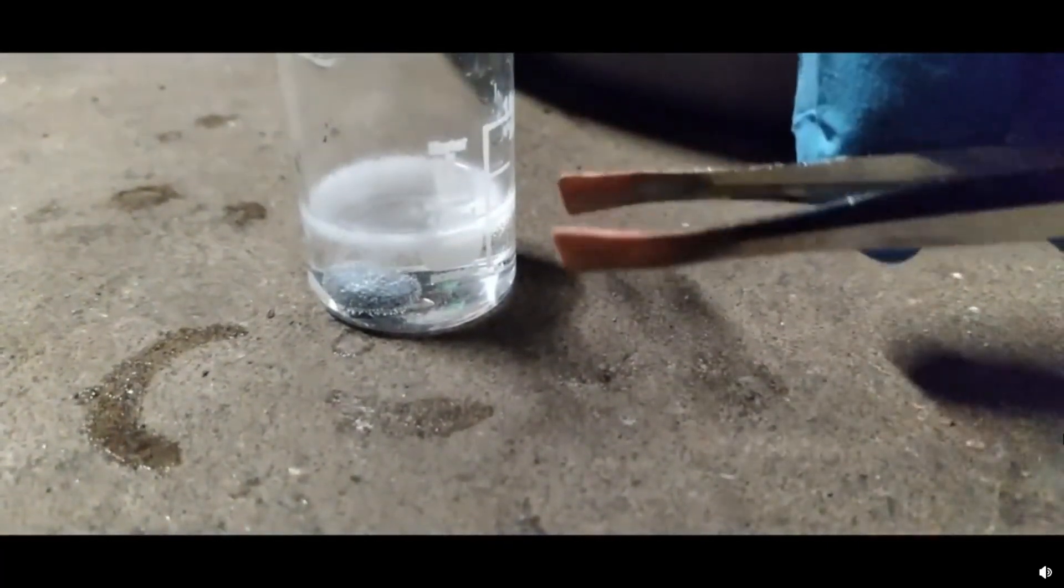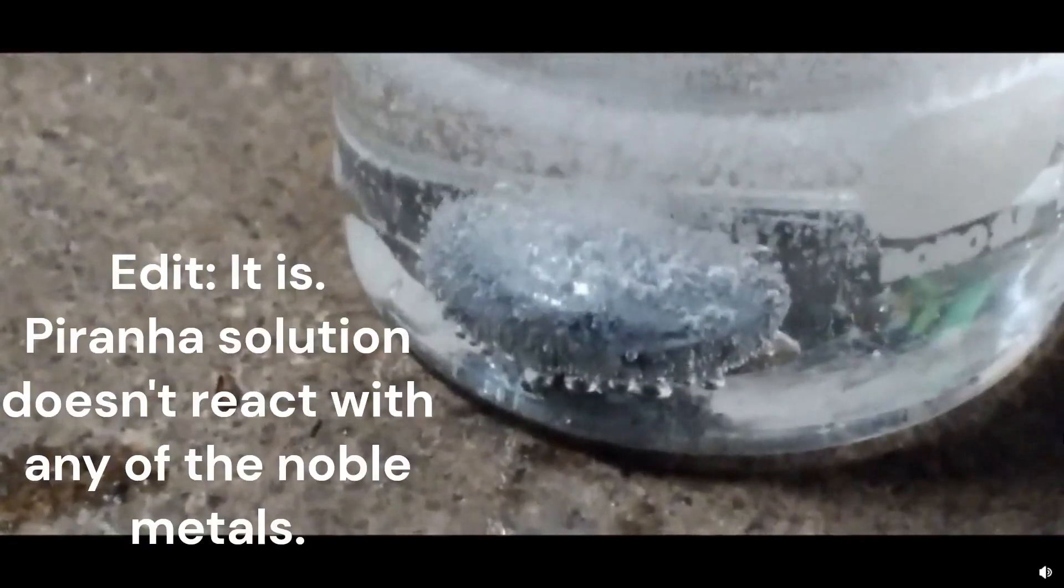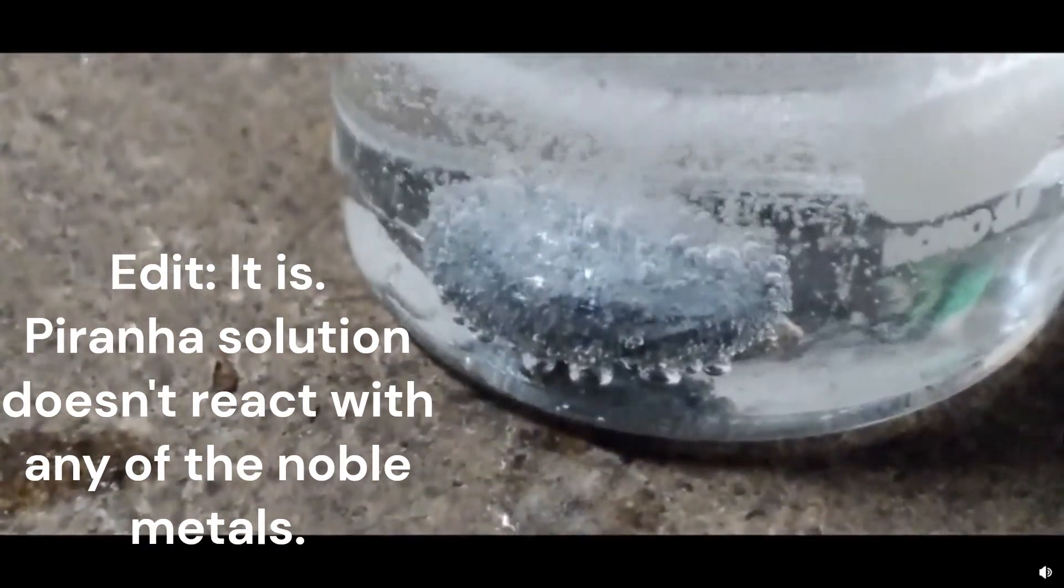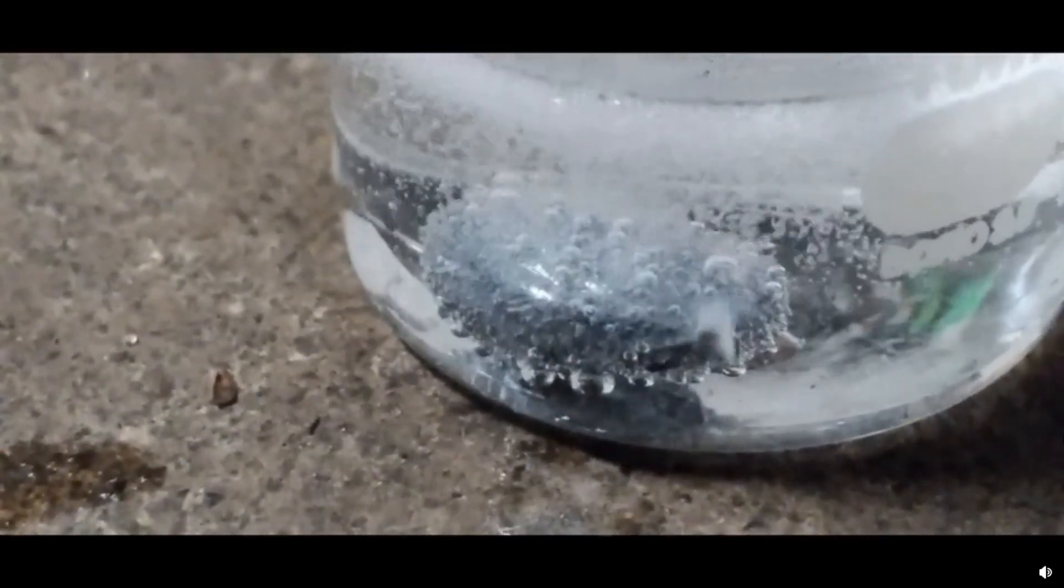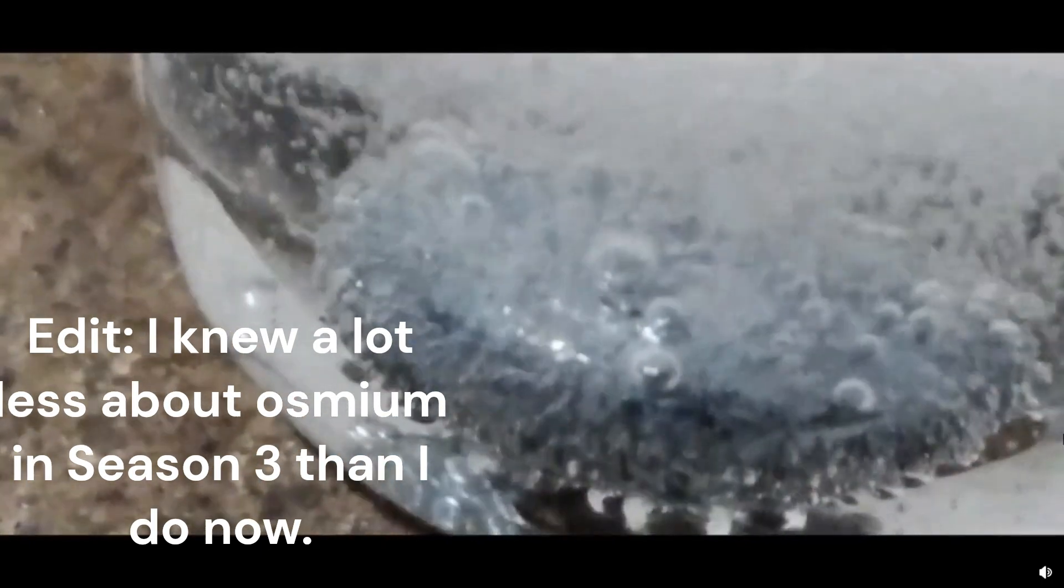Holy fuck. Look what it did to the tweezers. Holy shit. All right, it doesn't like this at all. I think that's the peroxide decomposing, honestly. I don't think the Osmium still looks fine. That's gotta be the peroxide decomposing. The Osmium is still shiny in there.